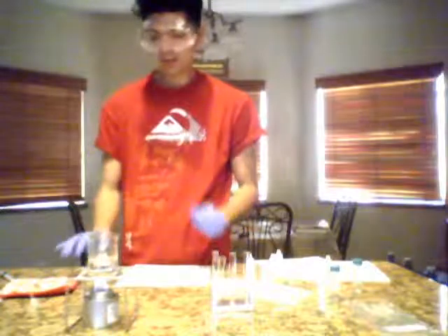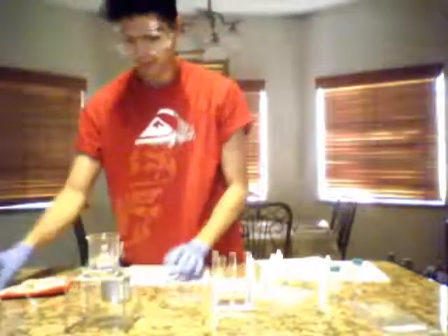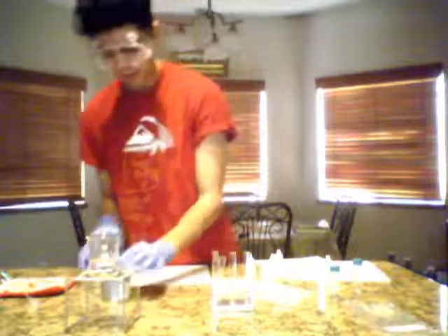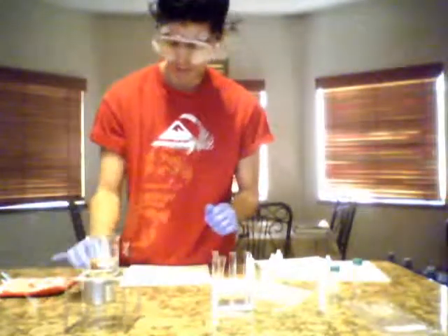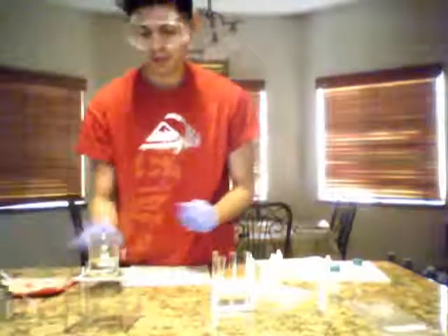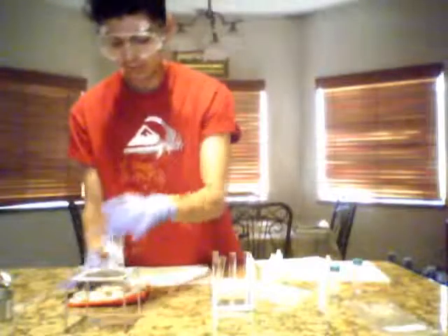Okay, so our water has begun to boil, so we're going to extinguish this flame. And like before, all we're going to do is just cover that right there. Make sure it's out. It's out. Okay. And we are just going to move this really fast to right here.